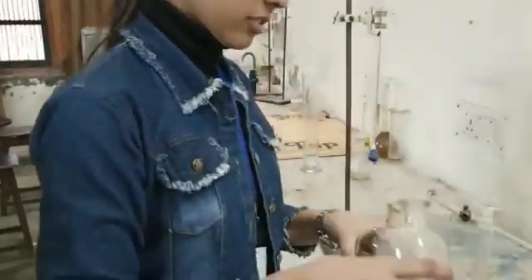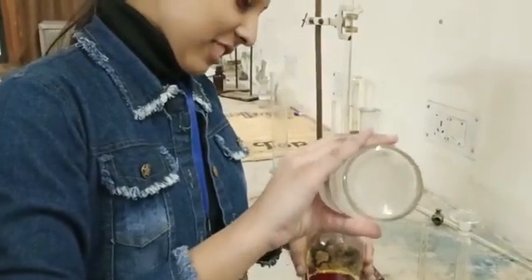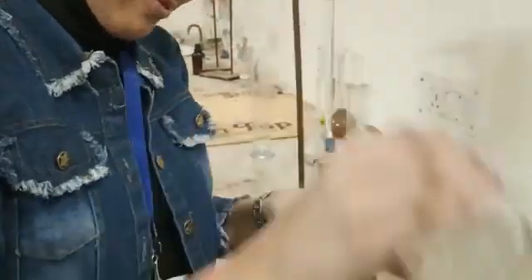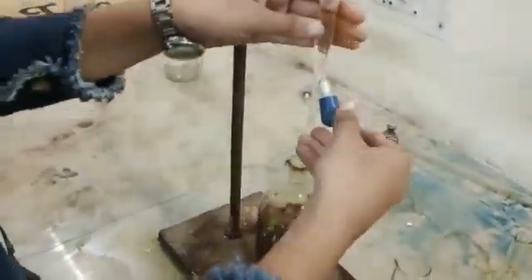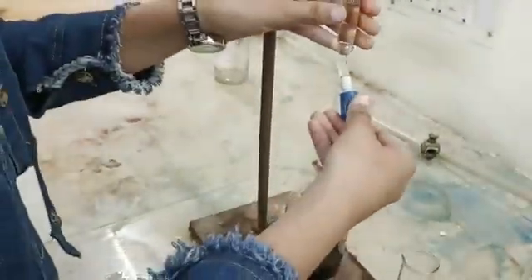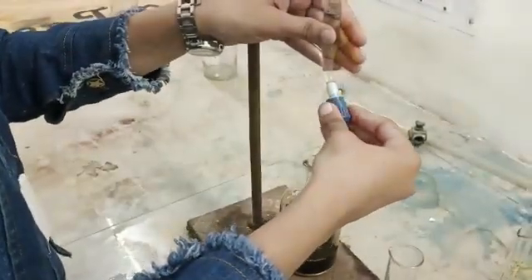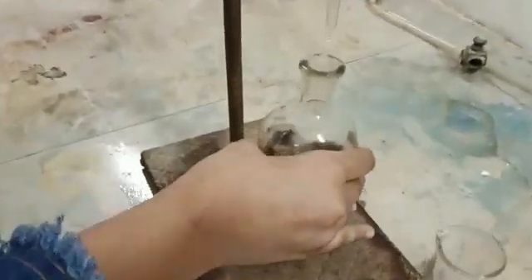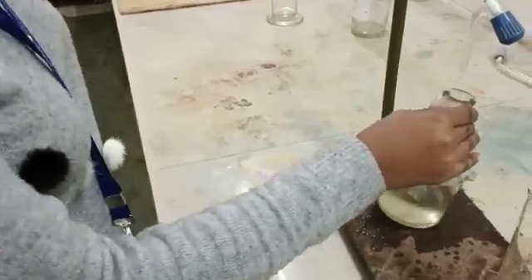Now we are going to perform it. The colour of the solution is deep blue. Now we will titrate it, adding the sodium thiosulfate solution. The colour of the solution is now colourless, which shows the presence of phenol.